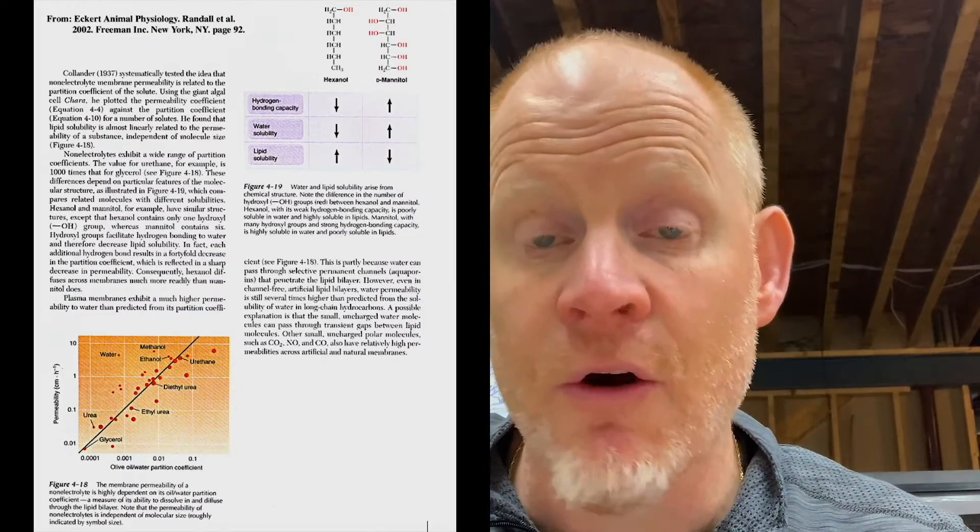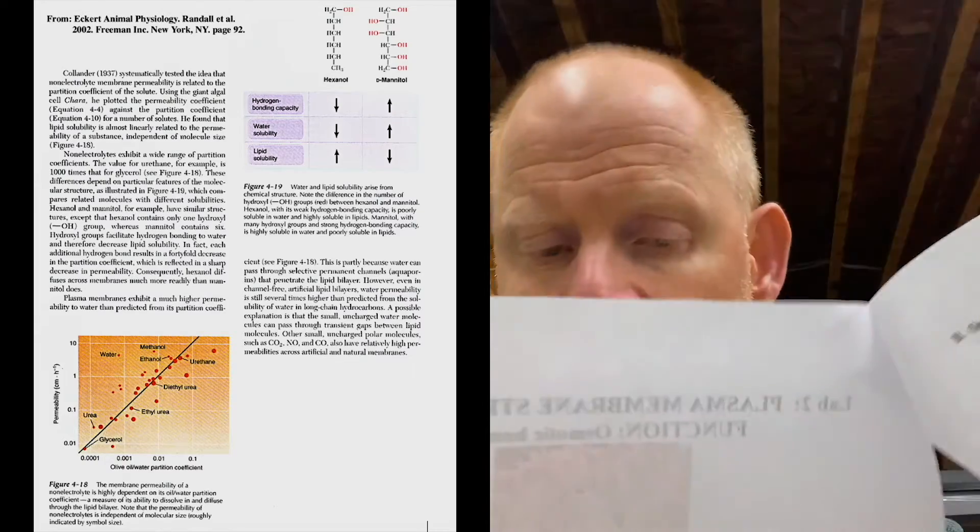I'll walk you through here on the lab handout. The first page or two describes a partition coefficient again, molarity versus osmolarity, permeability of ions and molecules. Part one is looking at permeable solutes, or what we call penetrating solutes — these are solutes that can cross the membrane by themselves. The speed at which they do that is based on their partition coefficient. The lower the partition coefficient, the more polar they are, the slower they move across the membrane. The higher their partition coefficient, the more non-polar they are, the faster they move across. Partition coefficients and size are found on page three of your lab handout.